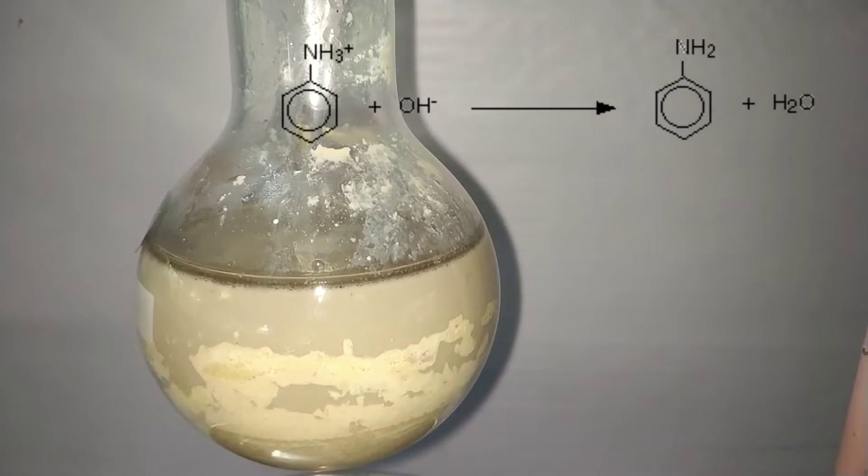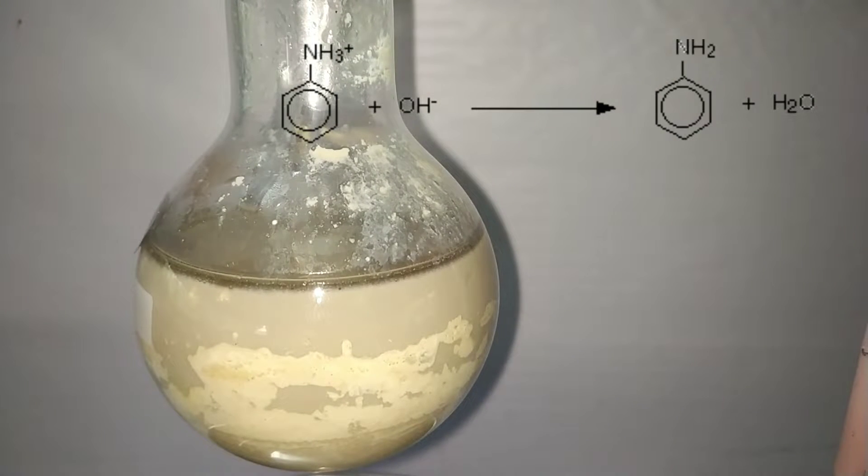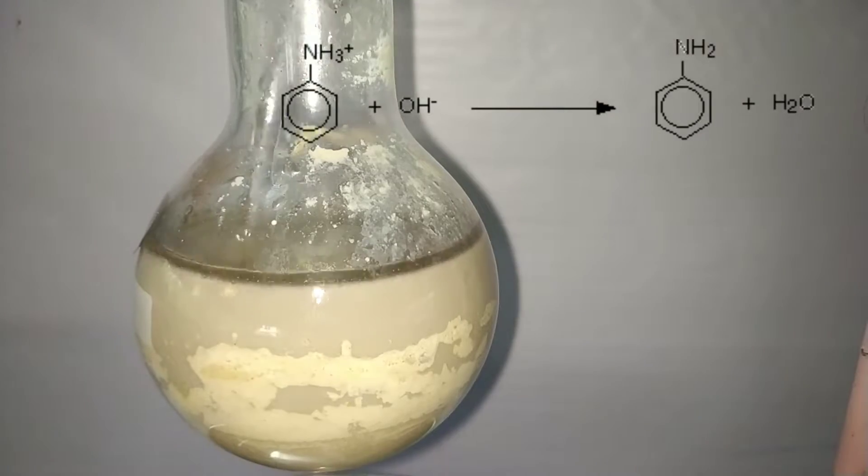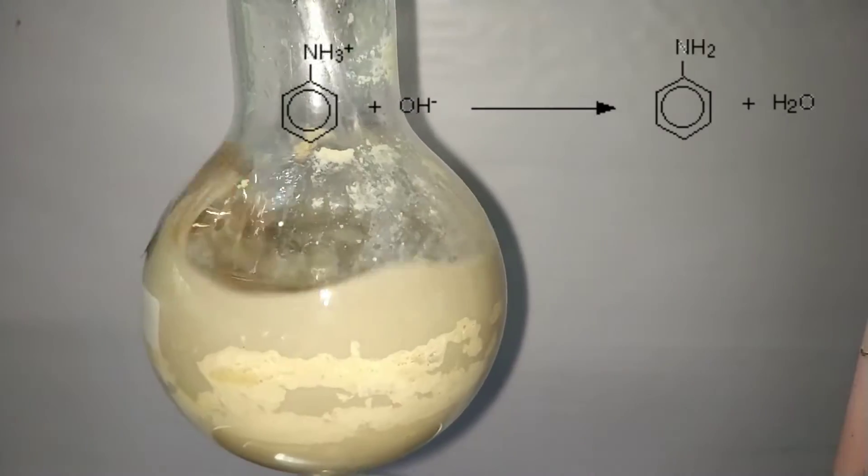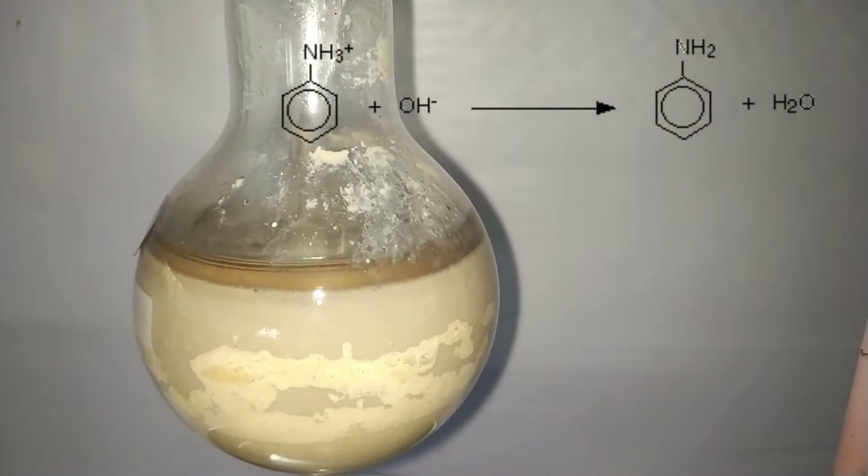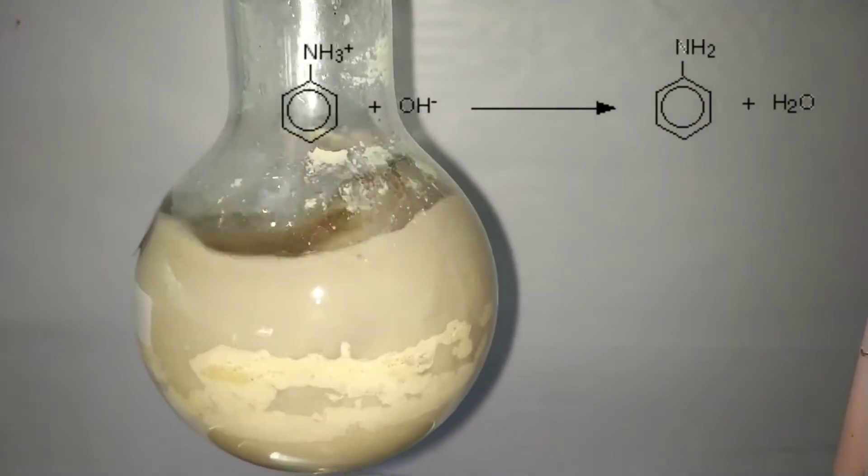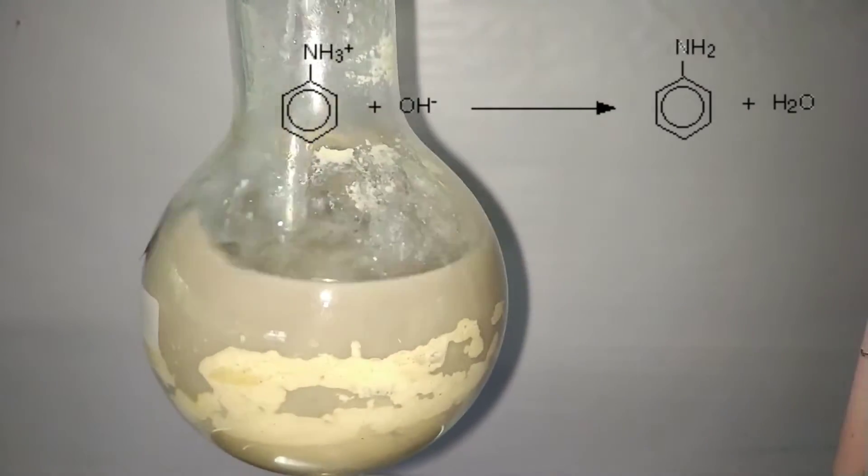What is happening here is the H+ of the phenyl ammonium combined with the OH- of the alkali, releasing a molecule of water and aniline is separated out. Sometimes aniline may not separate out and this is also okay.